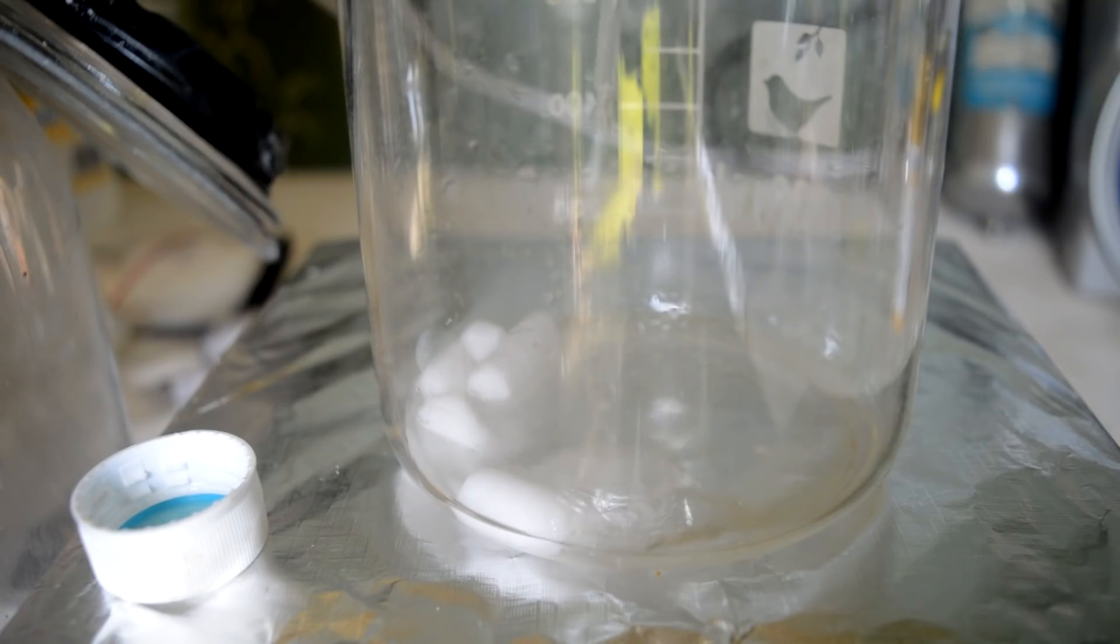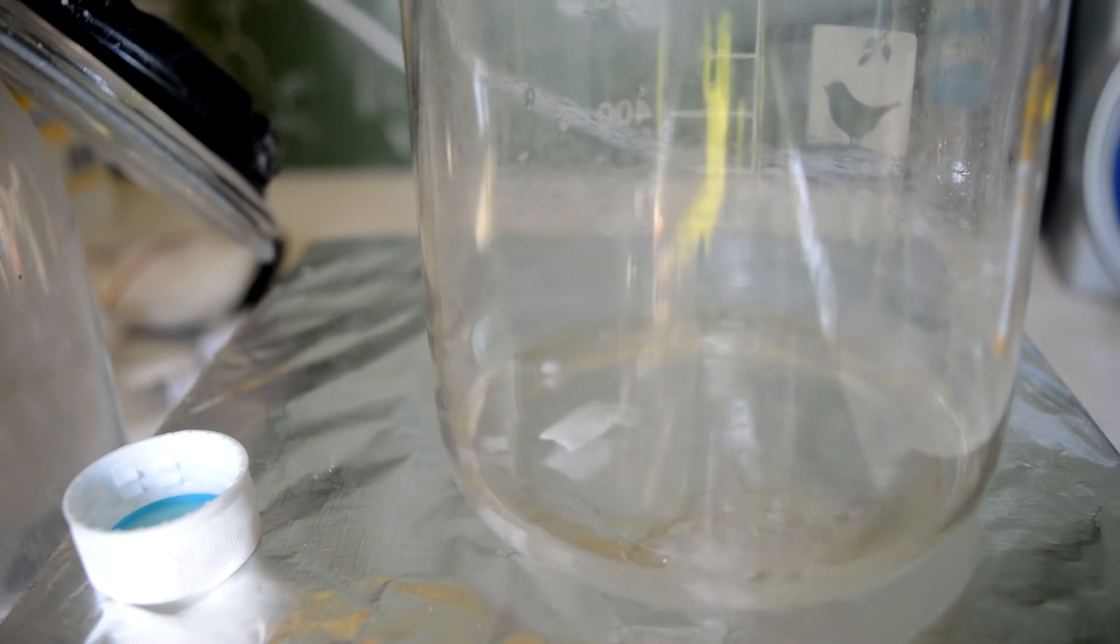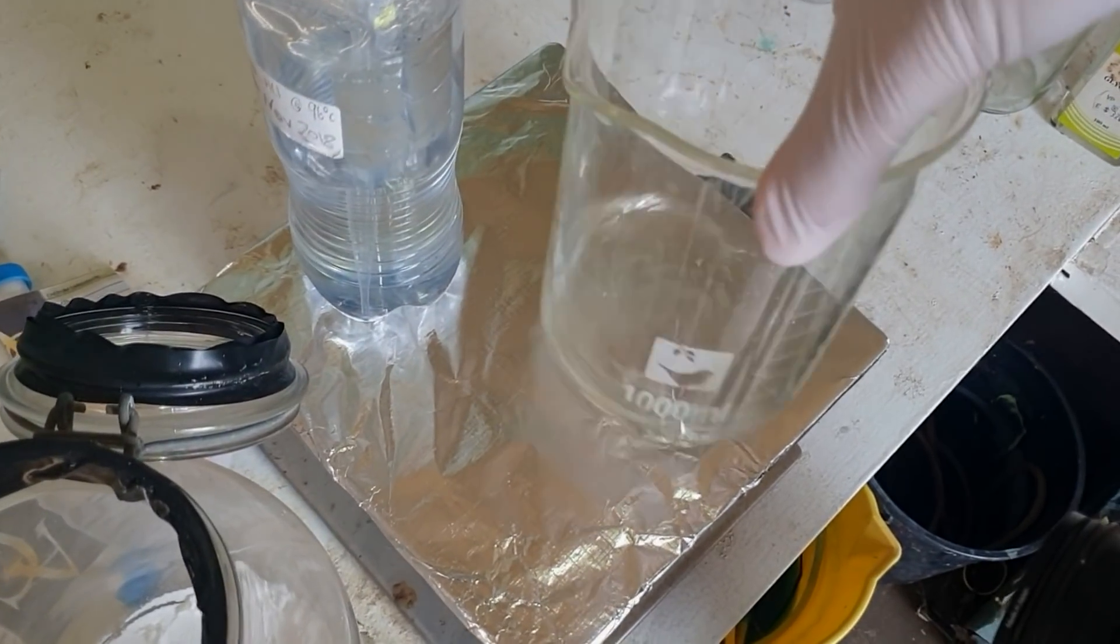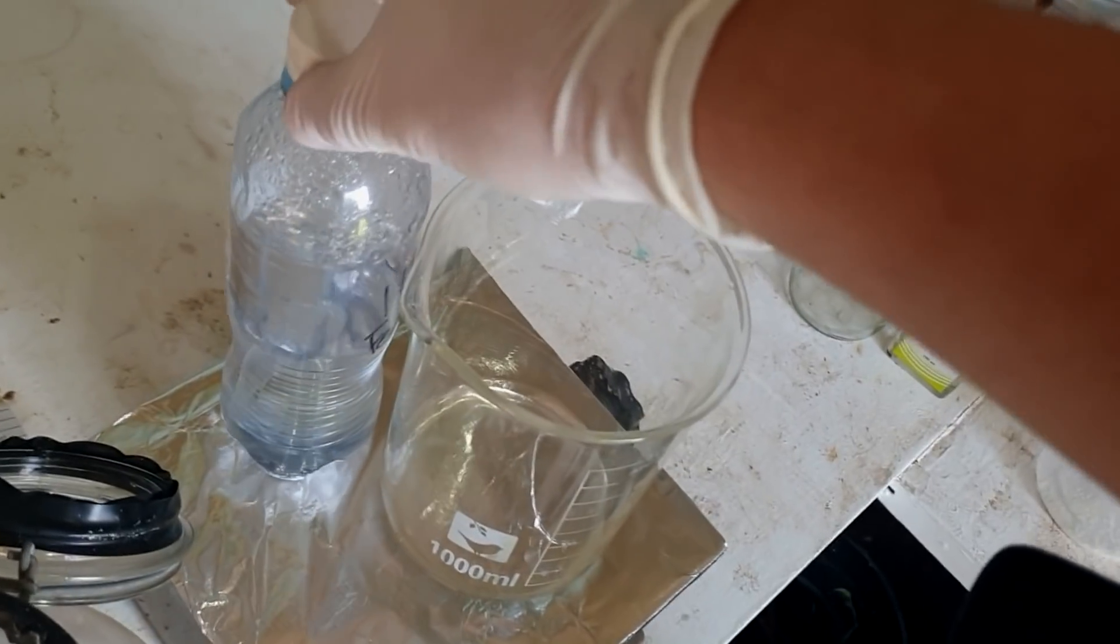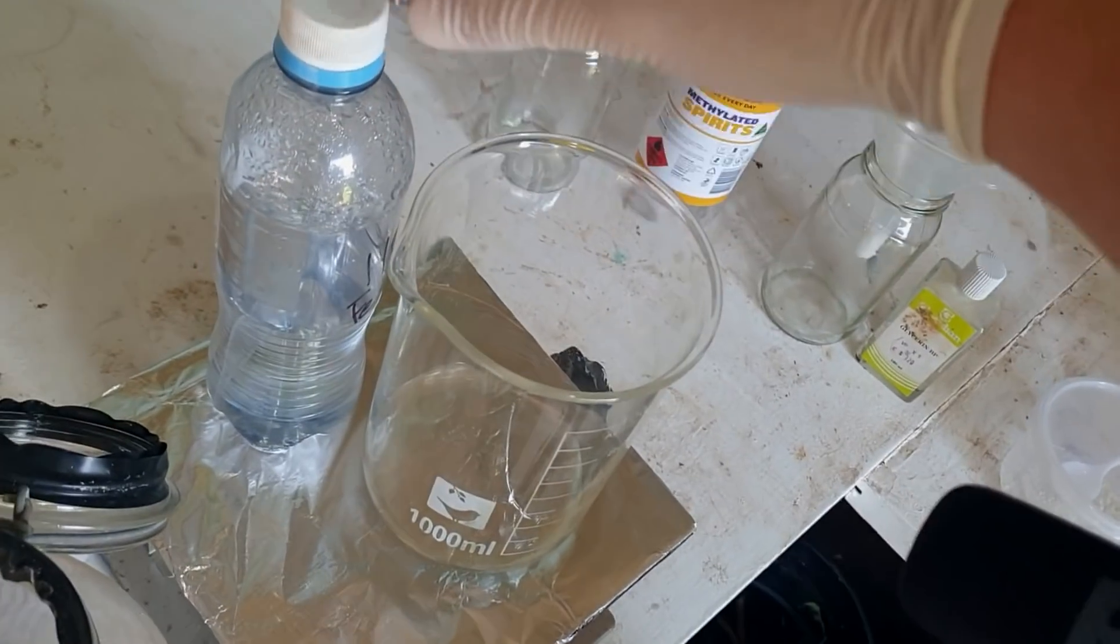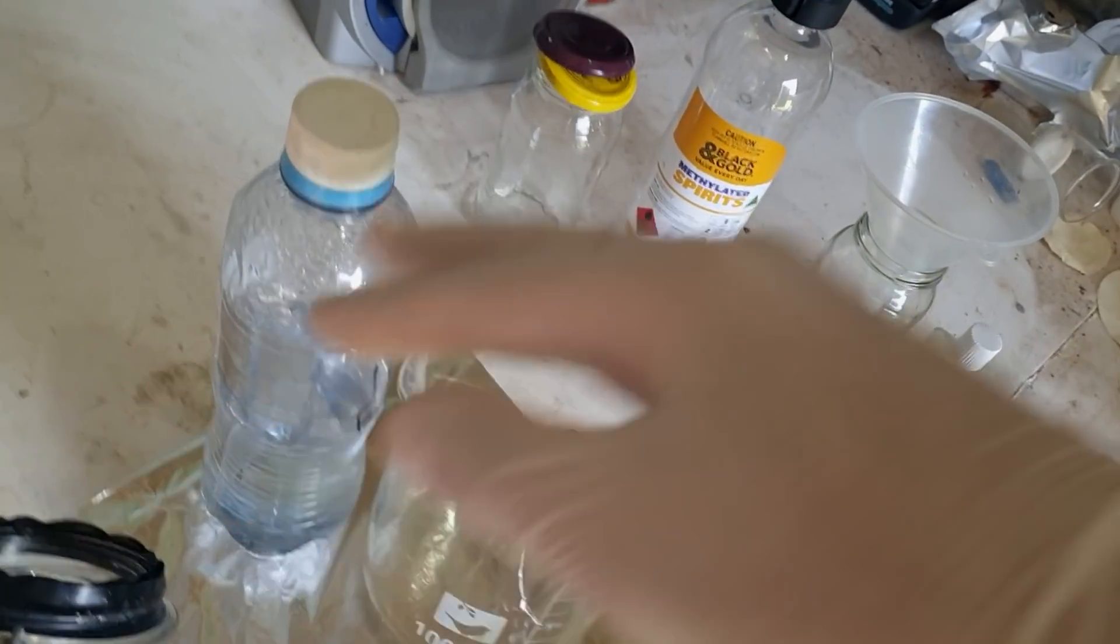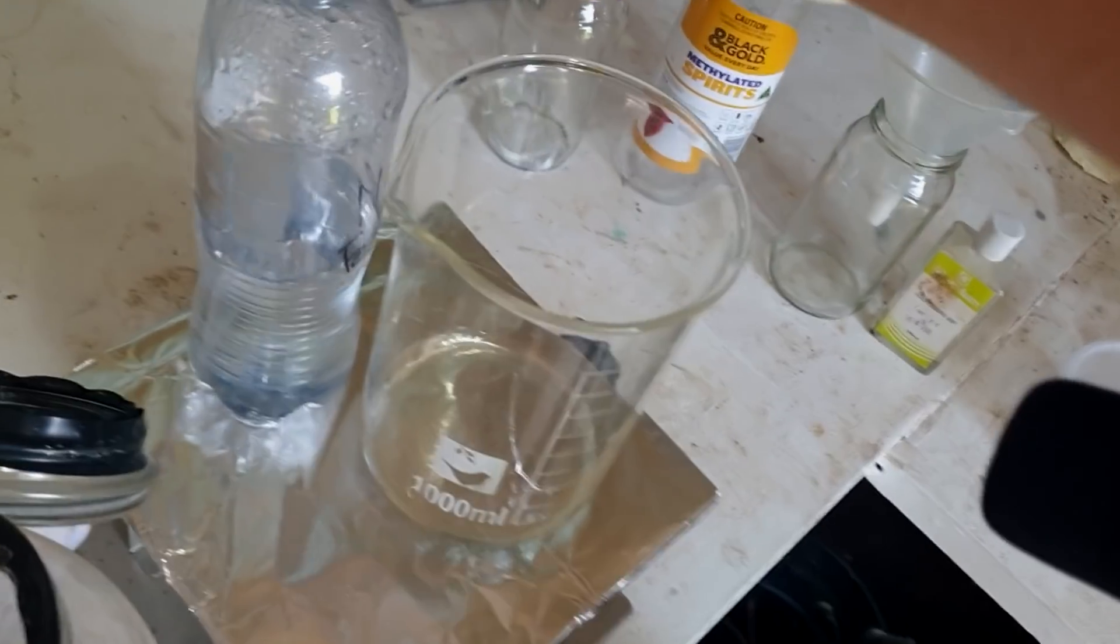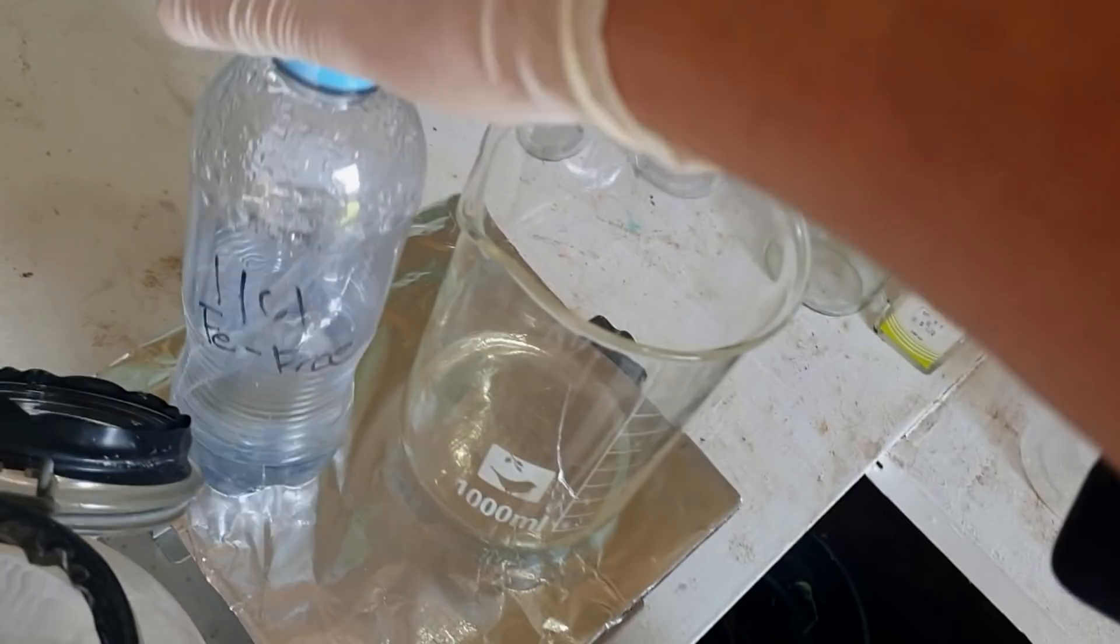Wow, that powder really set to the tube. You can see it even kept the shape of the tube perfectly. That's funny. Alright, that went fine. Everything is dissolved, apart from the fact that I dropped one of the pipettes in the bloody container. I used to do that all the time in undergrad in the labs. The lab supervisor would have to come around with a pair of tweezers and get the pipette out. I'm going to have to get that out somehow.